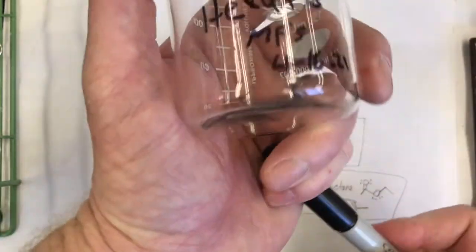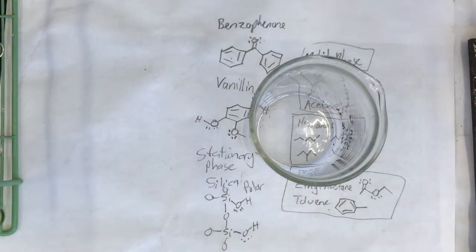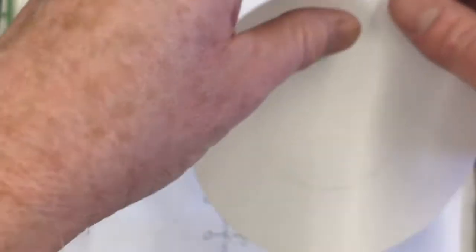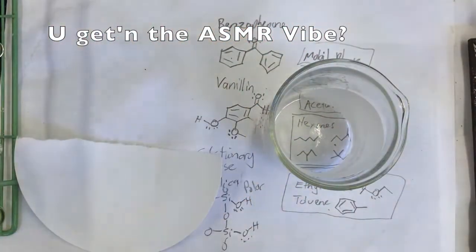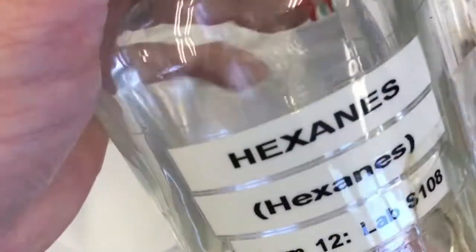And I will get another filter paper, put that in there, and then add the hexanes. Okay, I got some Whatman 12.5 centimeter filter papers. Just tear it in half. Put that in there. And now my hexanes. I grabbed some hexanes from the flammable cabinet. Here are my hexanes.